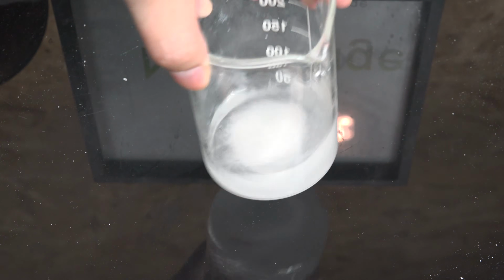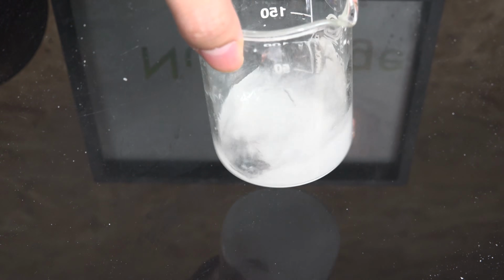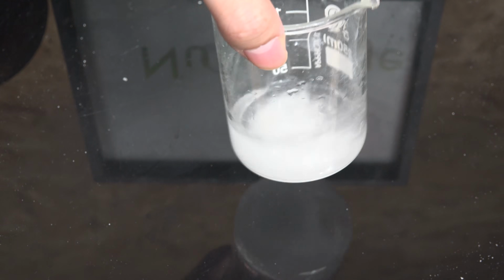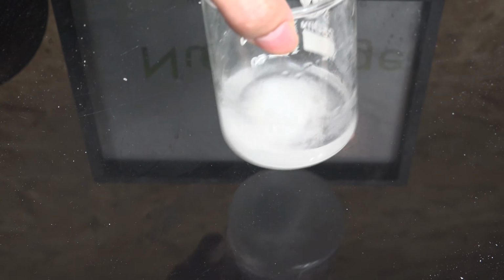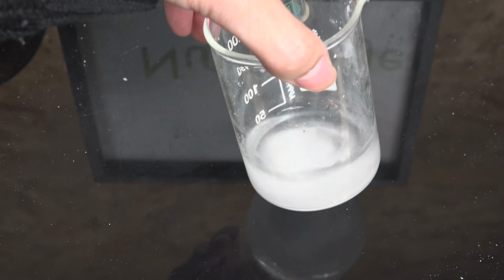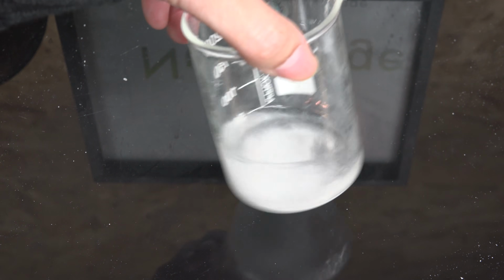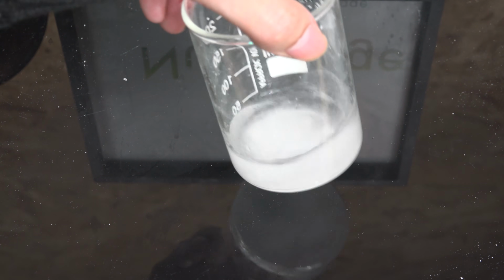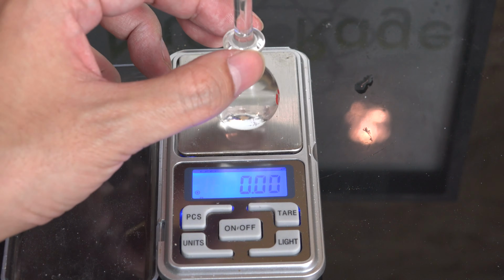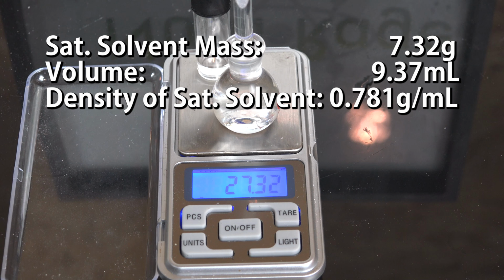Now we mix in some of our powder and try to dissolve some to create a saturated solution. I know very little will dissolve, but this improves the accuracy because by using a saturated solution, we turn low solubility into near zero solubility. If you're measuring something with actual zero solubility, like say the shavings of a metal alloy from your forge, you can skip this part. Now we use the pycnometer and measure the density of our saturated solvent. This is what we'll use to measure our powder.